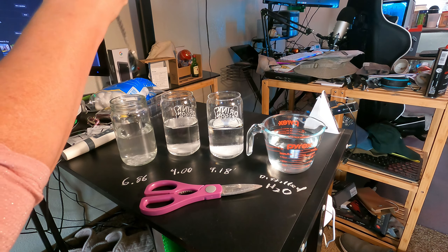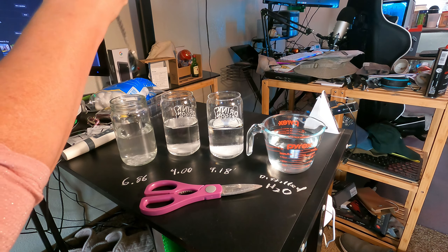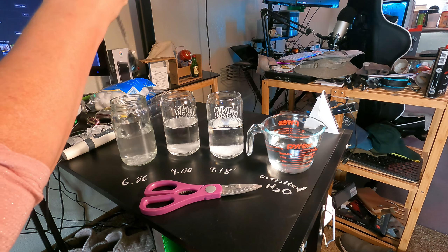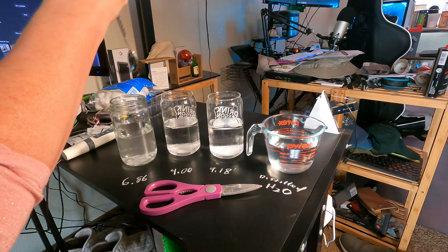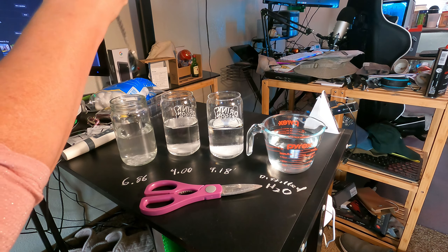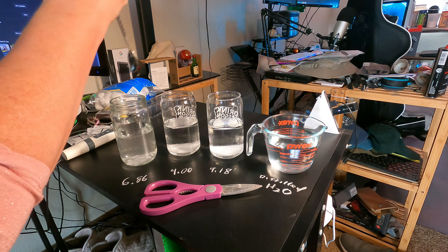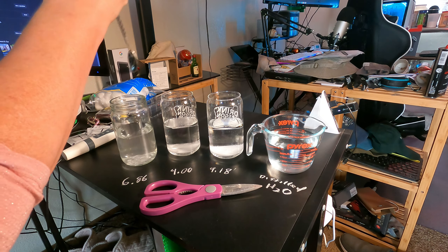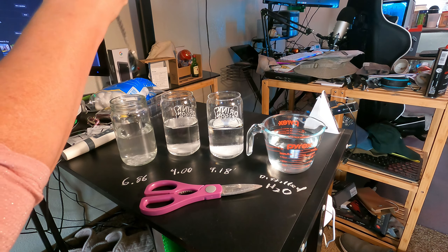About halfway, a little more, just a little more. Just in case — one, two, three. Wow. It is between 6.5 and 7. It's between 6.5 and 7. So I think I am going to bring it down just a hint.